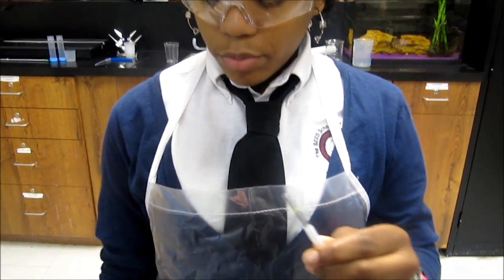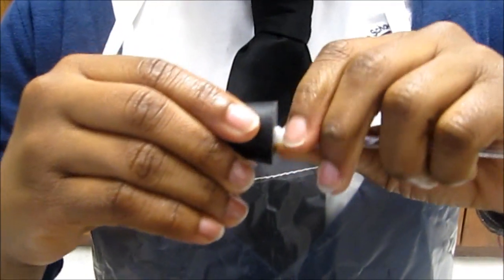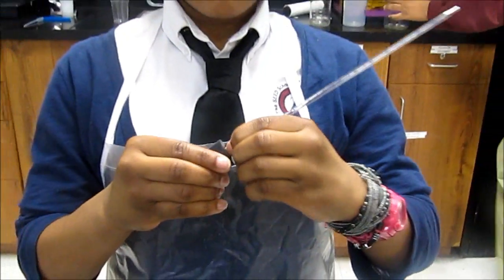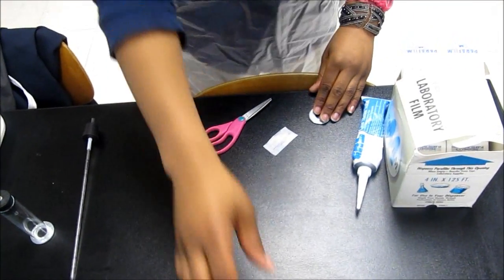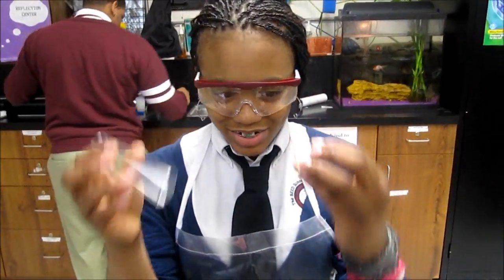Take the rubber stopper and push it so that you can get to the yellow line right here. Make sure it's airtight. That's the top piece. Now, making the bottom piece, you need to glue these two together.